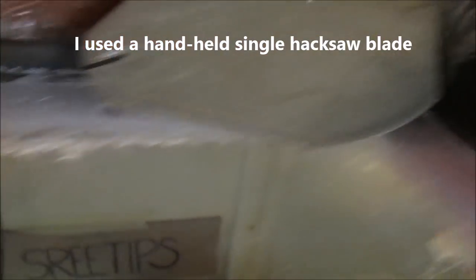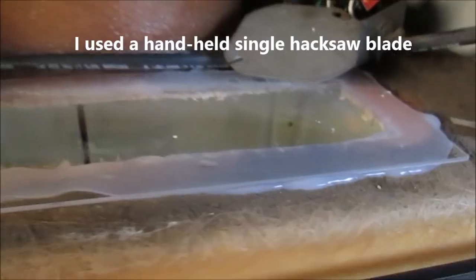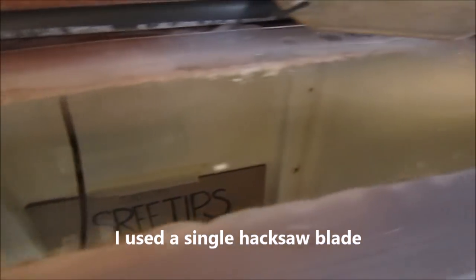Anyway, what I've got here is the piece of plexiglass. I used a whole tube of silicone caulking to make a nice bead around the hole that I'd cut. I used a drill bit to get in there. You can see the little holes that I made to cut the fiberglass. And then I stuck a saw in between, just a hacksaw, and it cut through very easily.